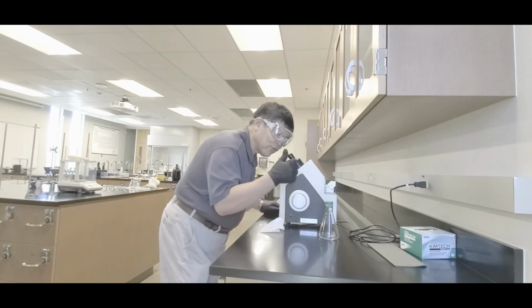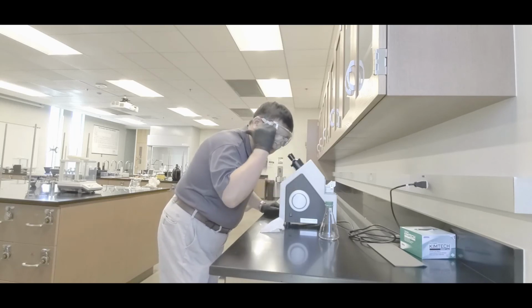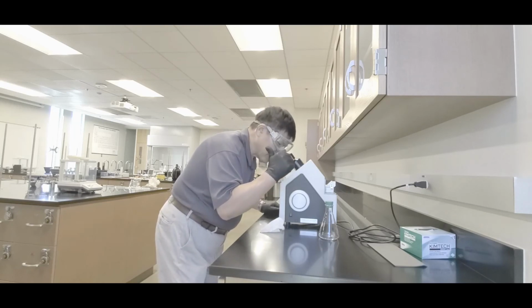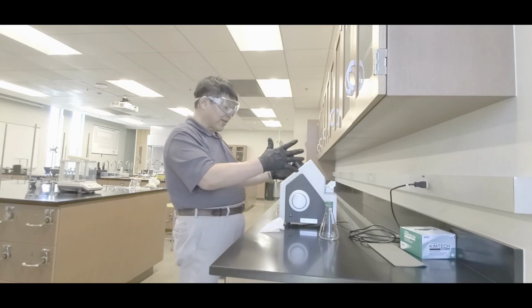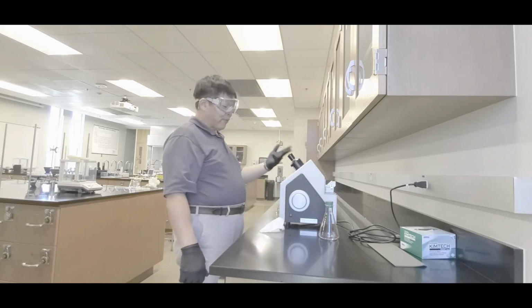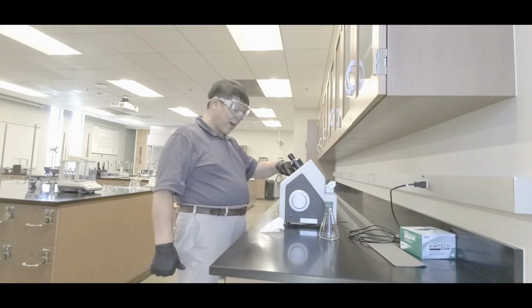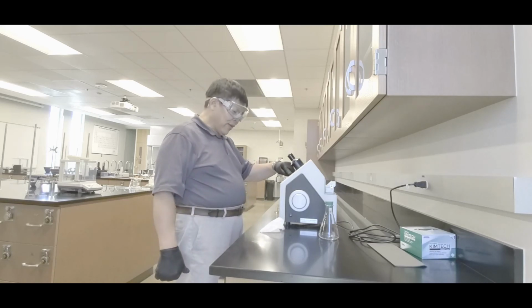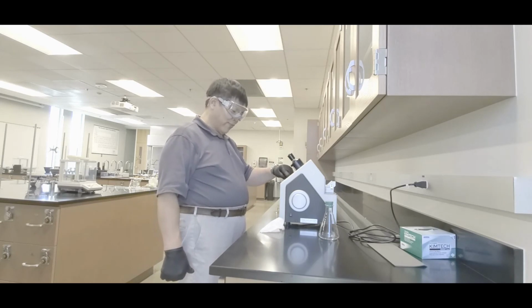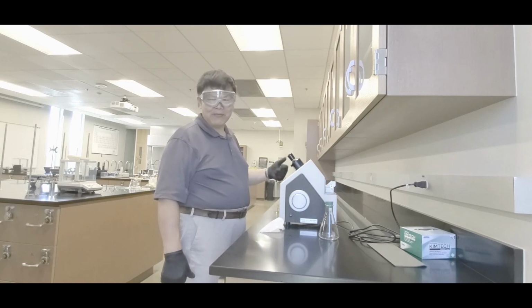I can't quite show you the image because the camera won't look in. I'll go on the board and tell you what it should look like. Once you have aligned it like that, push read. It'll take maybe a few seconds. There it is. It'll read the index of refraction on top, 1 point blah, blah, blah. And the bottom one says 25.14 degrees Celsius, whatever. Your sample numbers might be different, okay?